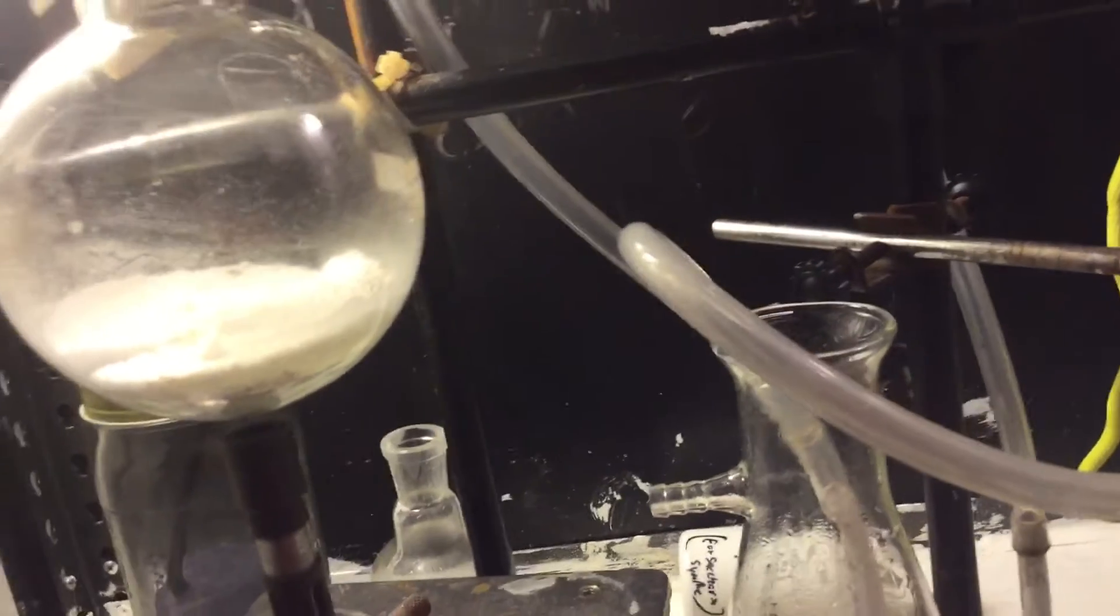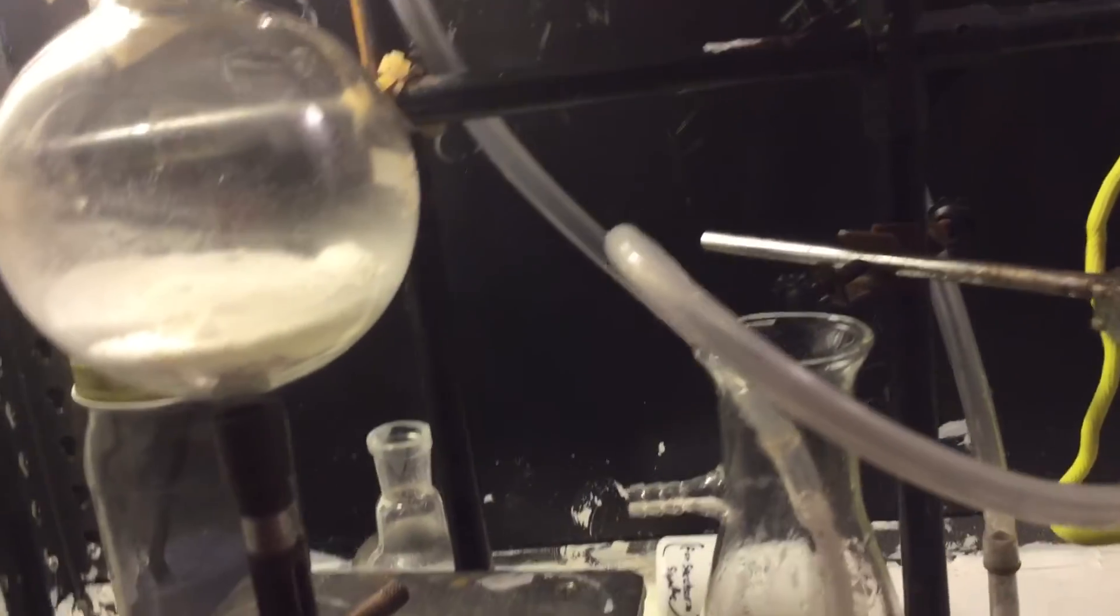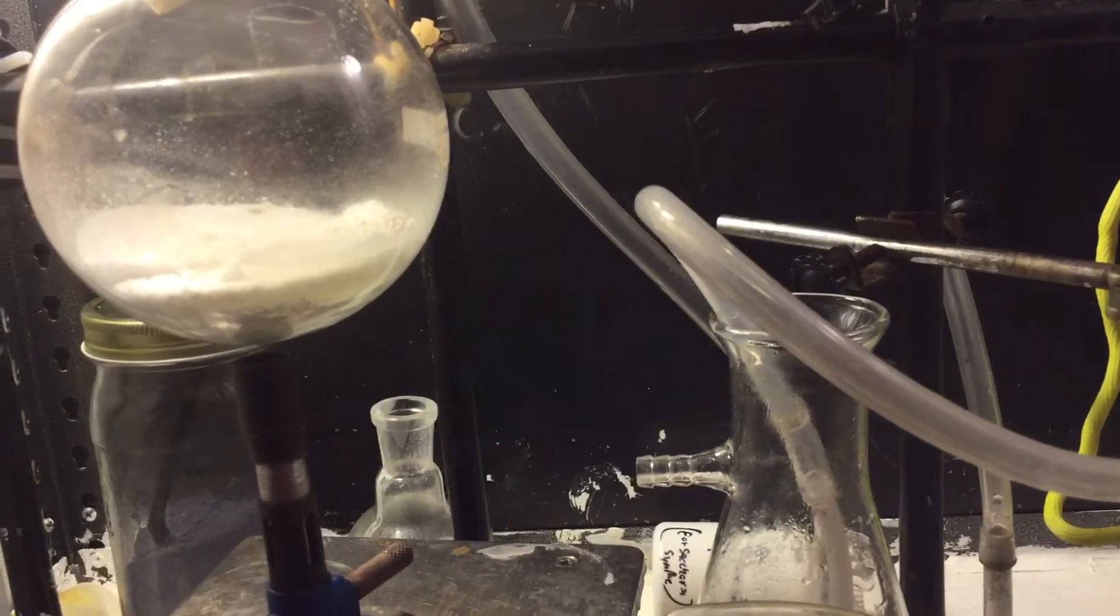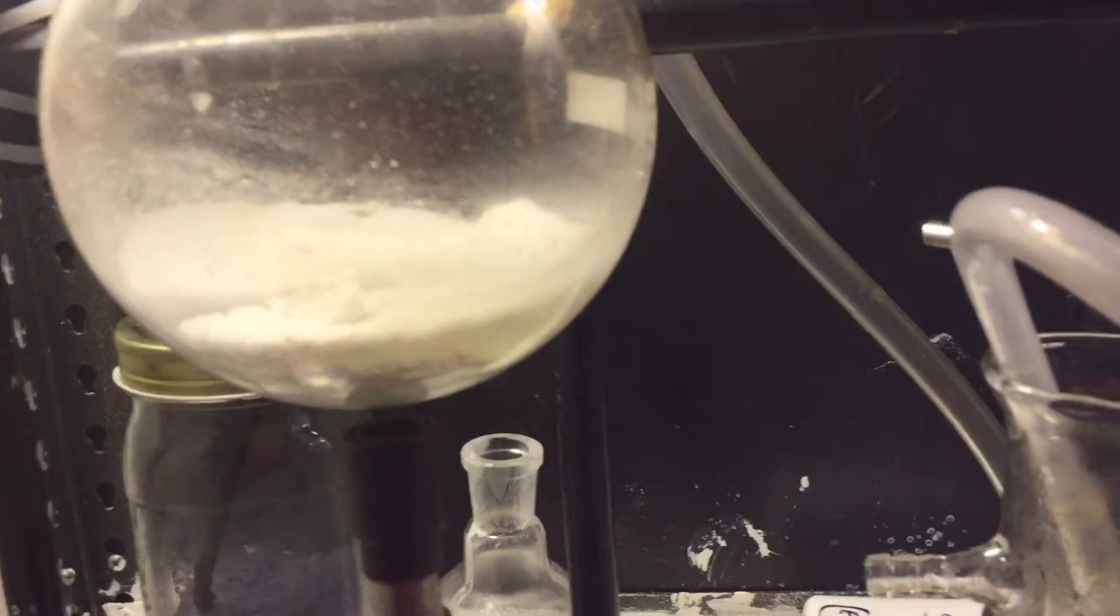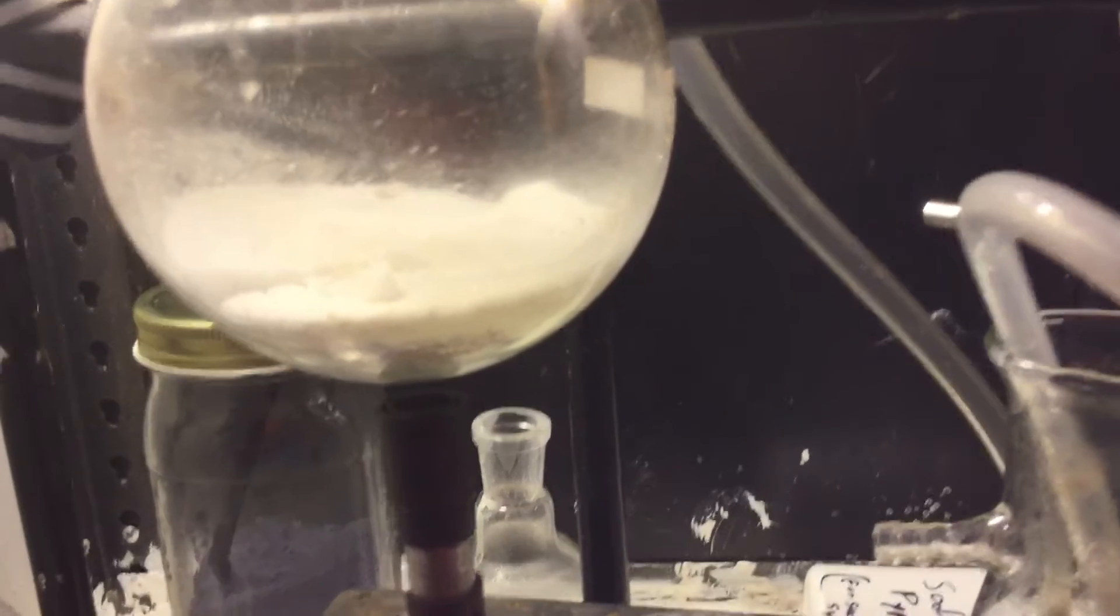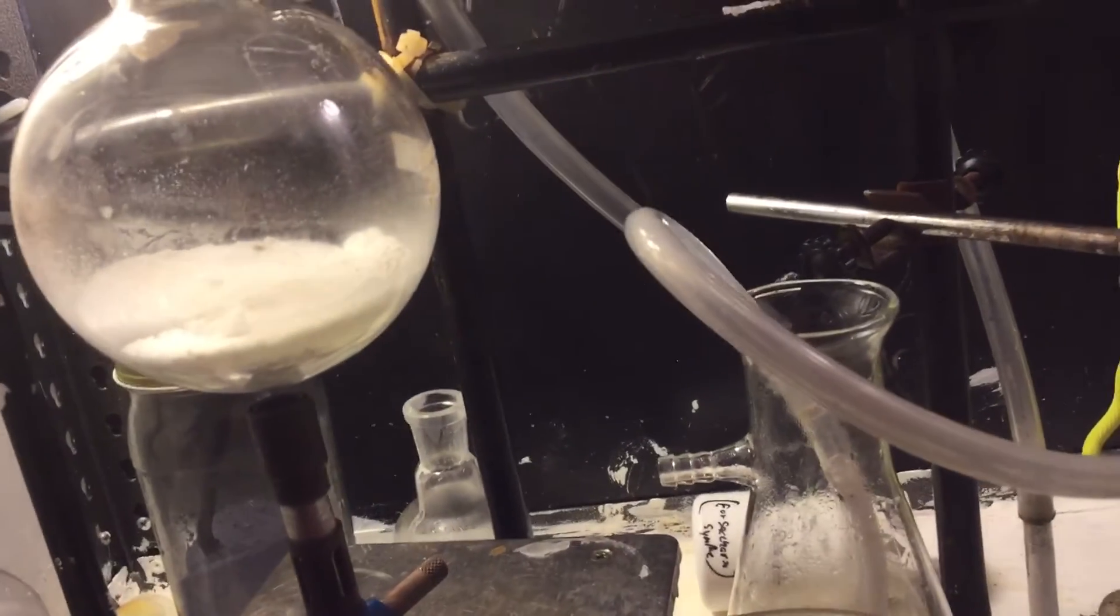That was some water and also some hydrogen chloride. So I guess, where did the sulfur trioxide go? Where is it? Because I have no clue. It's not in there. It wasn't in any of my glassware, definitely, and definitely not even in the HCl generator. So I'm a bit stuck on this.